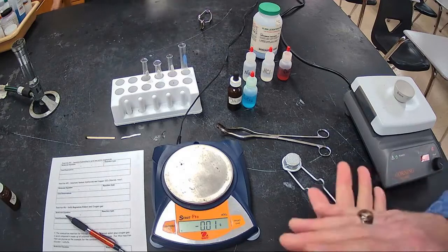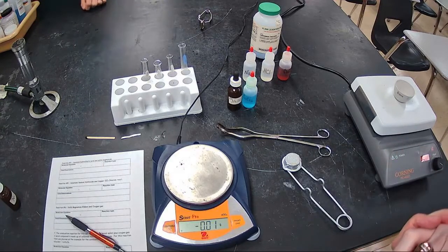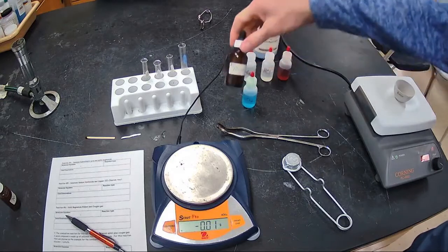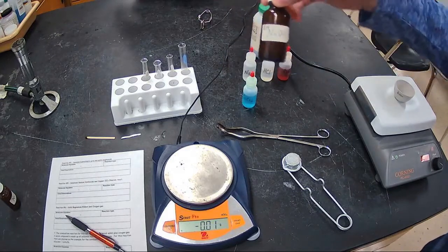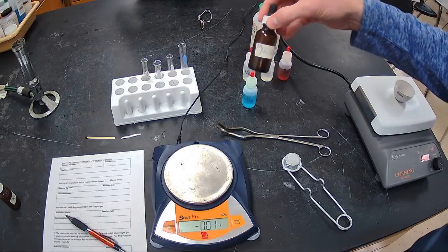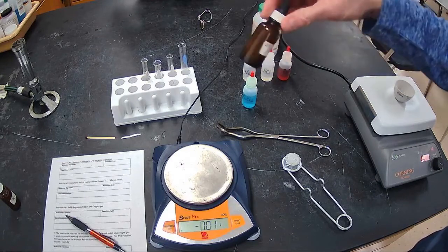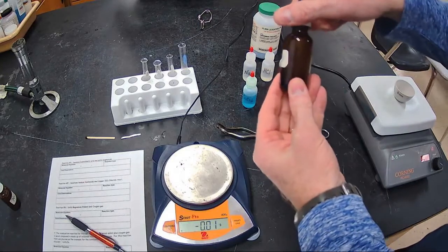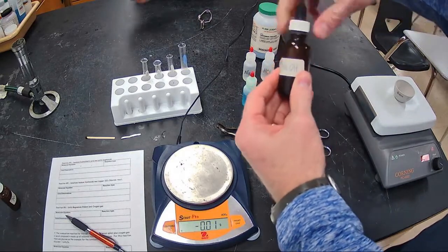So the next one we're going to do is reaction number 5, which is aqueous sodium hydroxide and copper 2 chloride. So sodium hydroxide, which is a strong base. You'll find this in things like Drano, Liquid Plumr, Red Devil lye, things that unclog drains. It's very, very corrosive to hair and grease and dirt.